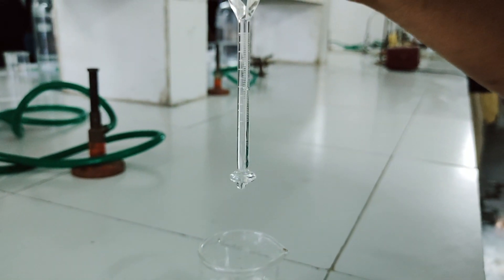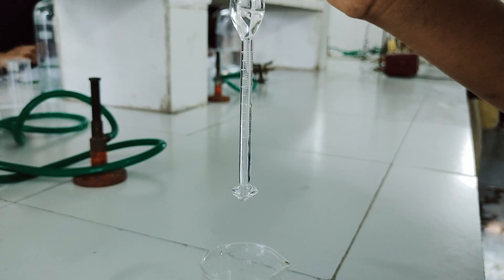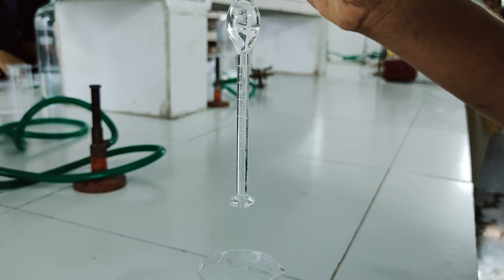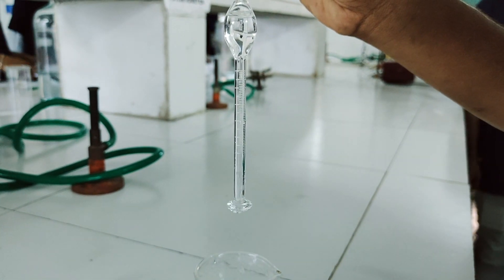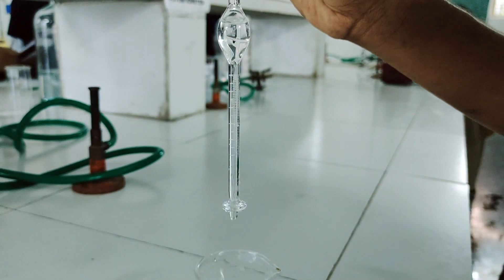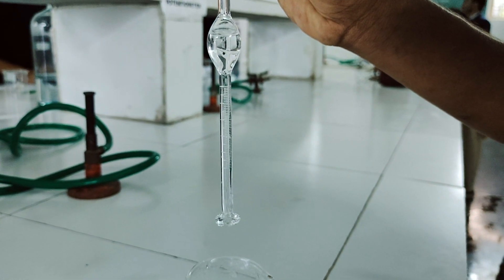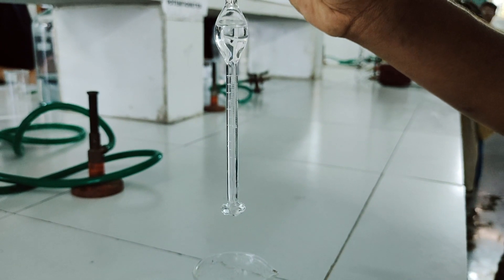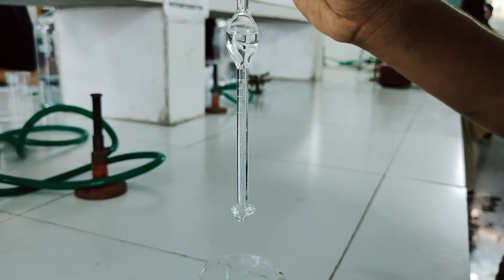Now allow the liquid to fall and count the drops: 1, 2, 3, 4, 5, 6, 7, 8, 9, 10. This is how you count the number of drops until the liquid reaches mark B.